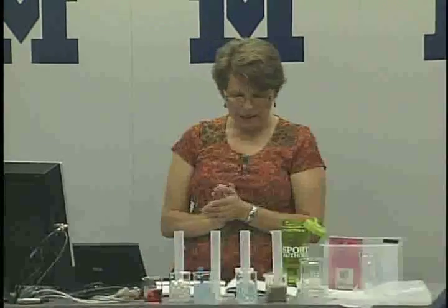So what we're going to do here is, as it says in your book, we need wax paper, water, ethanol, hexane, and we're going to need some droppers. Okay? So we've got all those materials. I'm hoping that the dock camera will be able to pick up what we're about to do. Okay? Now, if you ever use hexane or ethanol in a classroom, number 1, you have to use goggles.